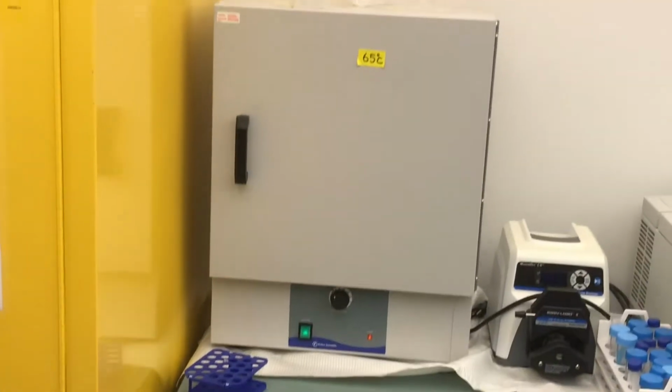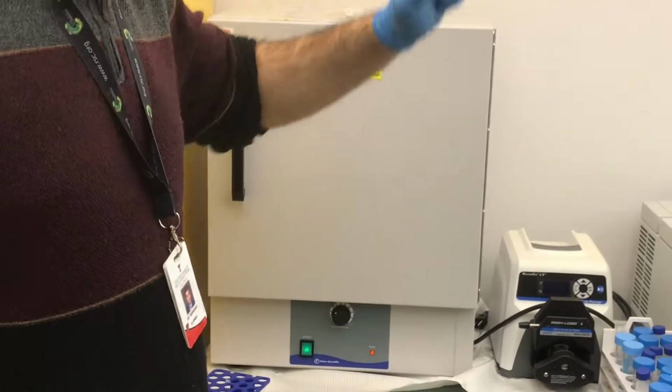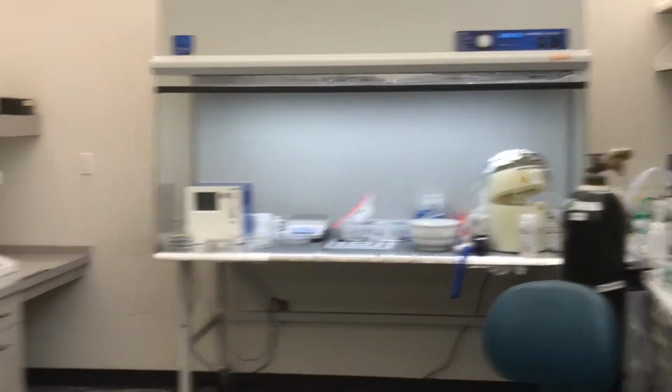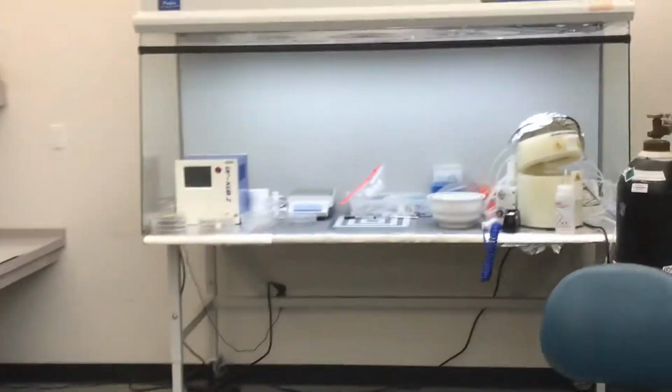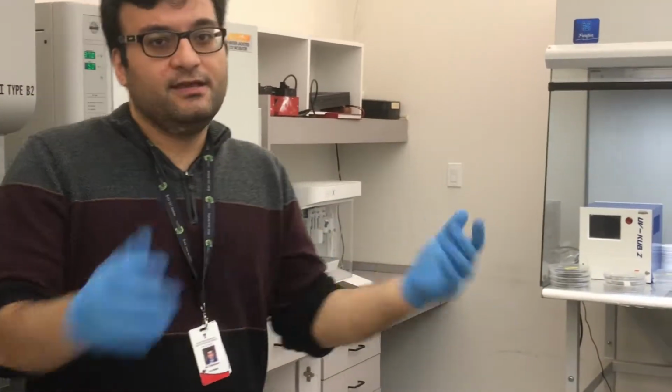For the RV chip, it's different. So after 2 hours, what are we going to do? After 2 hours, we just remove it from the oven and put it inside the hood, and after that we keep it overnight until it's completely cooled down. And tomorrow we will come to cut the chip and make the chip.